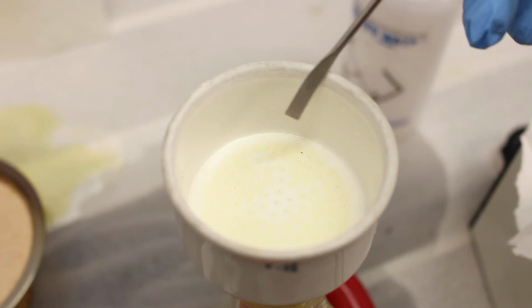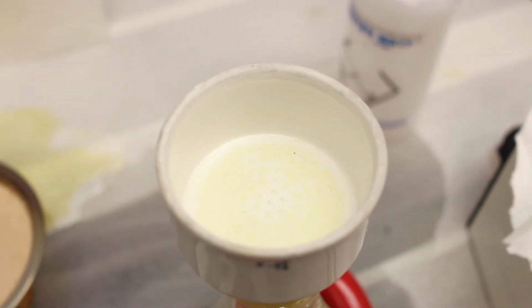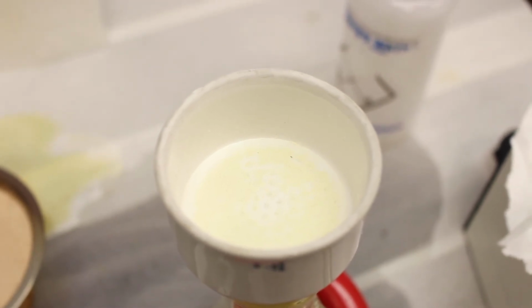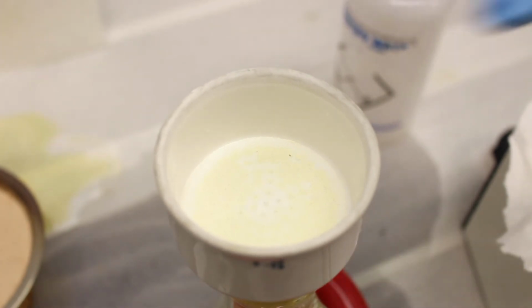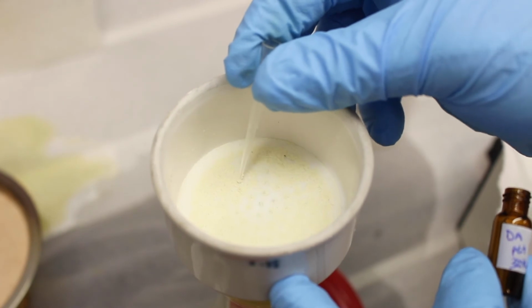Okay, so we have our solid here on the filter, and what we're going to do is first, before we dry it out, so it's still a little bit wet, but before we do that, I would like to take a sample for our mass spectrometer. So one way of judging purity of an organic compound is to check the mass spec. So we'll take a little bit of these crystals here.